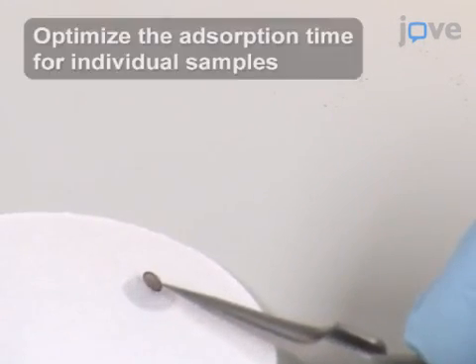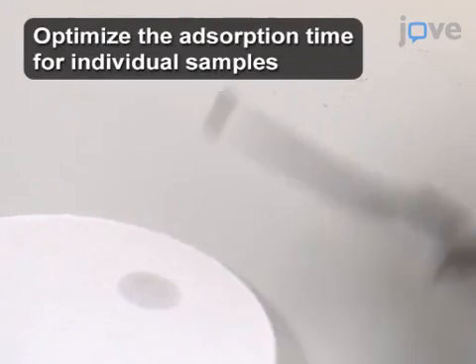Then touch the edge of the grid to a sheet of filter paper and allow capillary action to pull off the liquid.